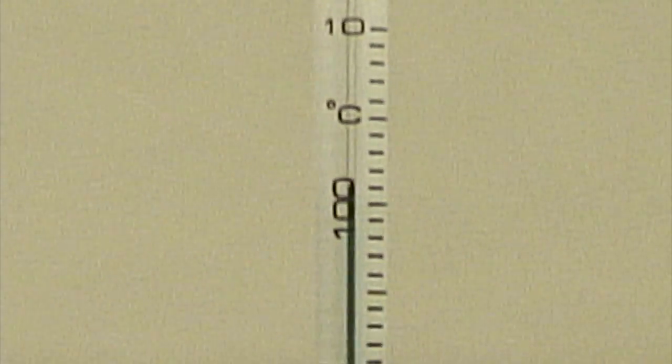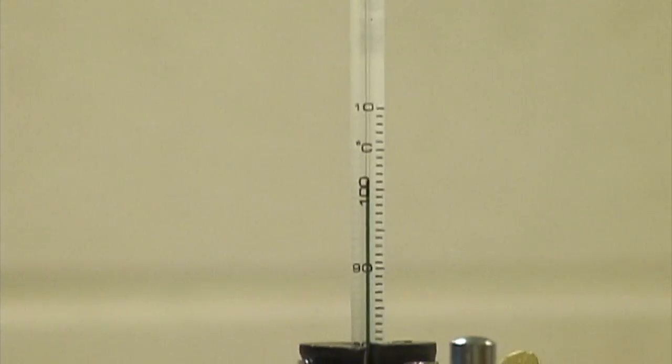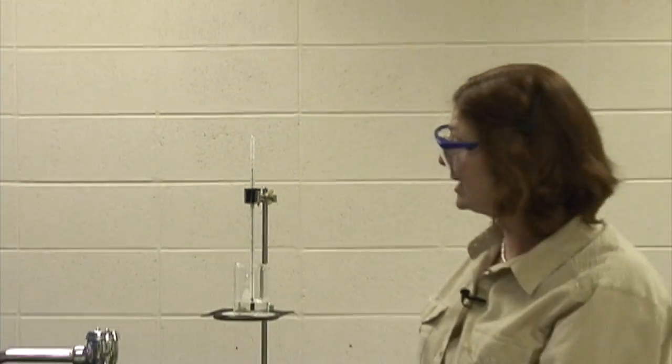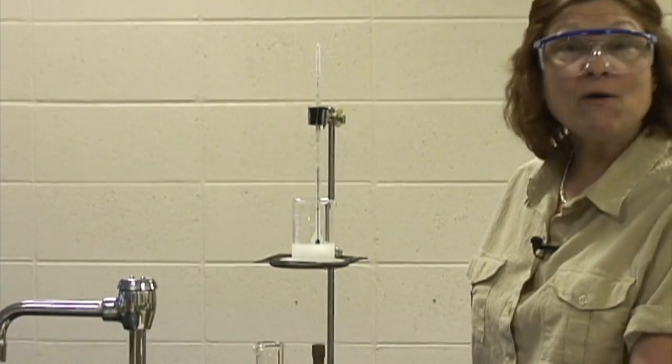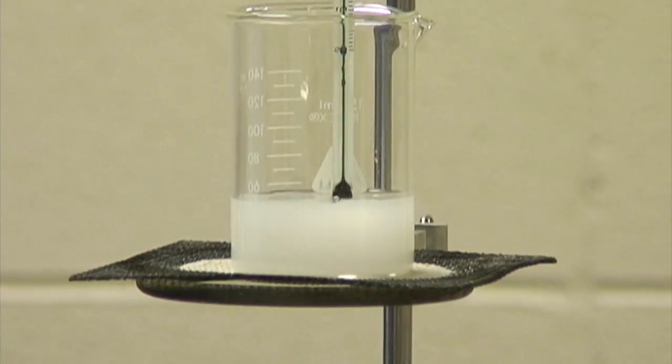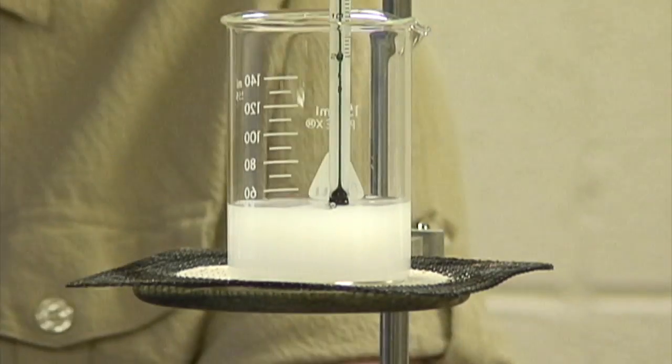I'm going to go ahead and rinse out the beaker and measure out 50 milliliters of my calcium hydroxide, get it ready to go, and we'll be right back. I have measured out 50 milliliters of my calcium hydroxide. It's the one that's cloudy. Well, very interesting. Now I'm going to light the Bunsen burner one more time and get it to the boiling point. And here we go.